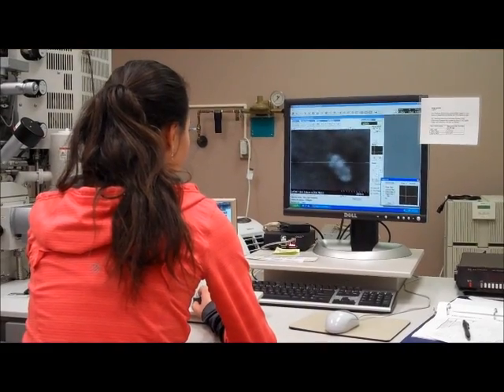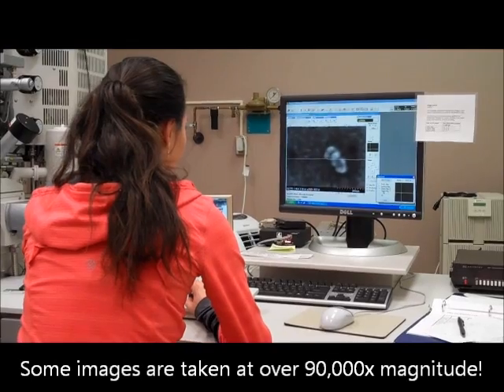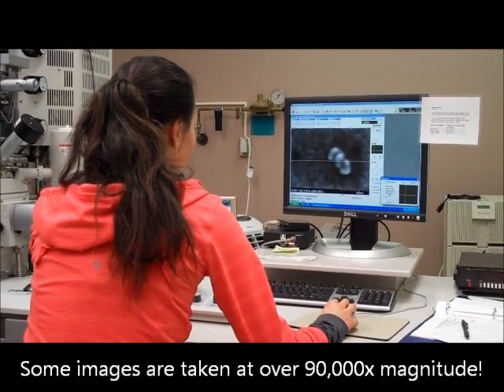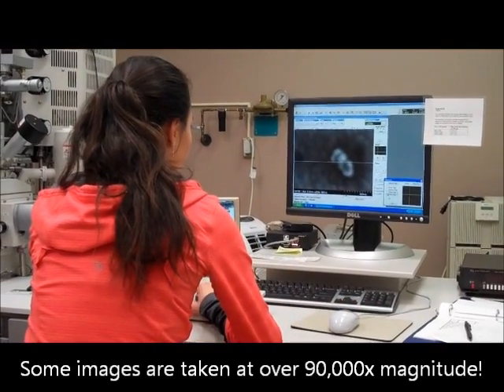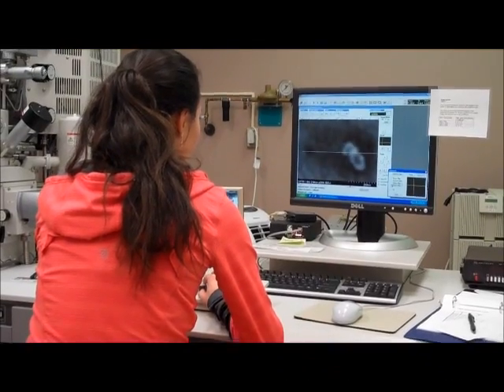So there's a lot of effort that goes into aligning the microscope, so that the optical conditions are the best that it could possibly be.